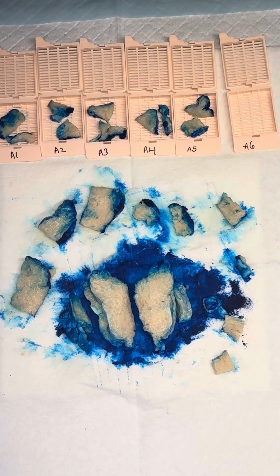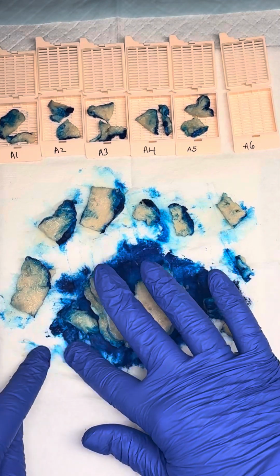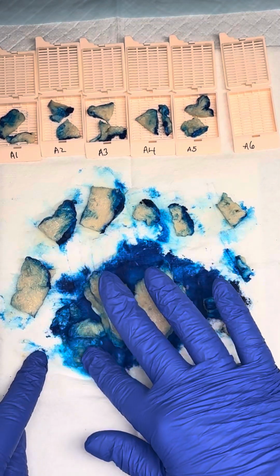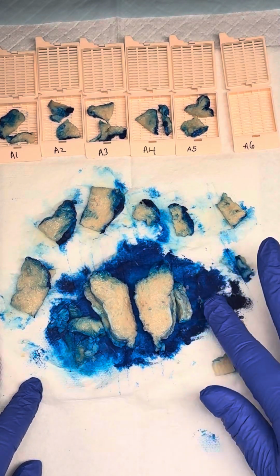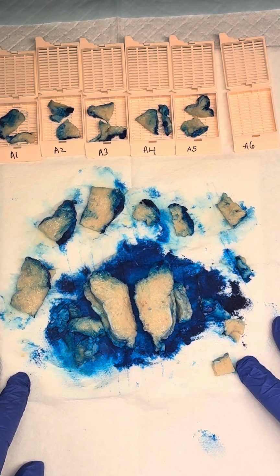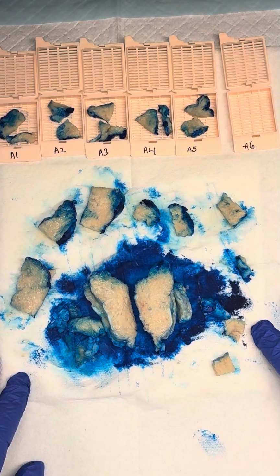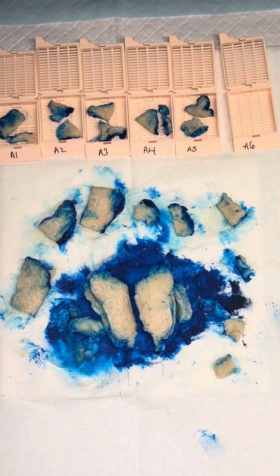And the other thing we want to do before we close out our case is look for any lymph nodes. We didn't have really a ton of adipose tissue on the outside of this thymus, but we would palpate through the adipose tissue, document any lymph nodes if we find them, describe what they look like, and give a range of greatest dimension. All of our lymph nodes we would submit entirely. And that's pretty much all she wrote for a thymoma.